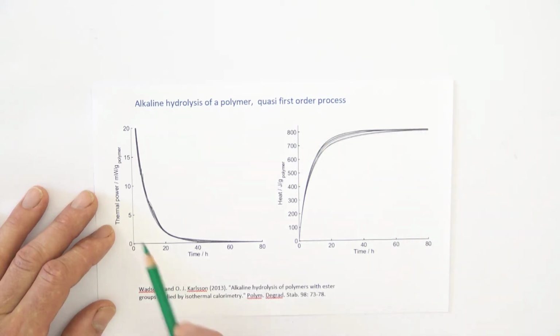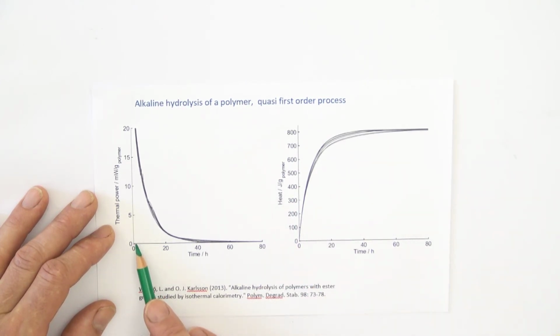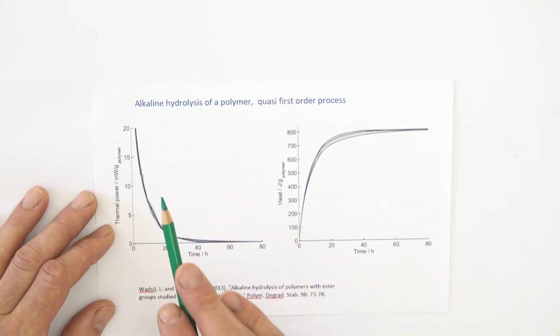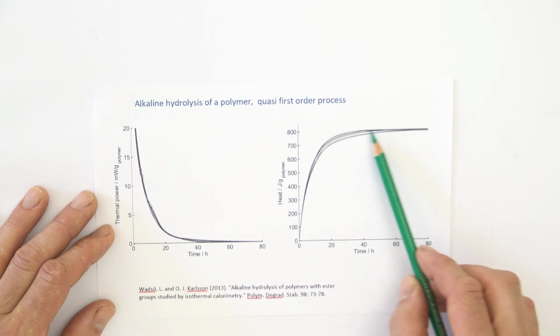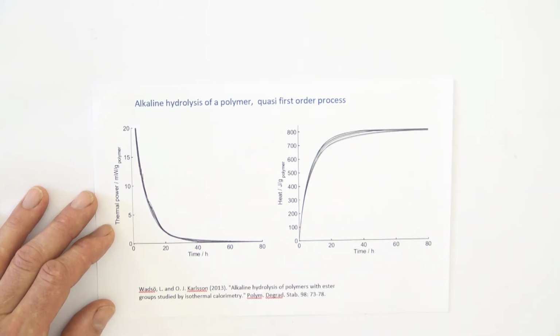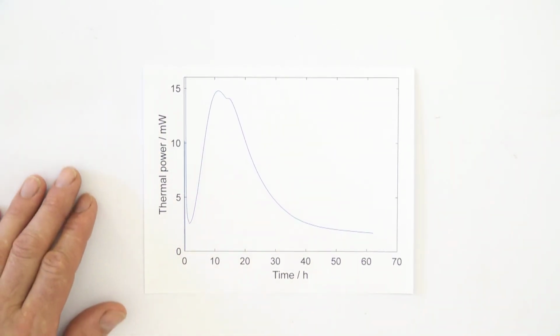That's good. But the problem here is that we don't know the thermal power during the first half hour or hour because of the initial disturbance. So in this case, to construct this diagram, to integrate, I removed the first hour of these measurements and replaced it with an extrapolated curve based on the measurements after 1 hour and later, an exponential curve fit. And then I could construct this heat. It would have been better if I didn't need to do this, but I had to do this because of the initial disturbance.